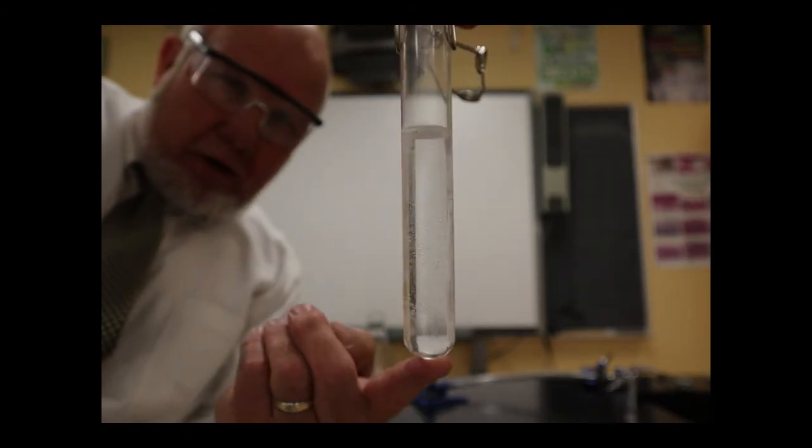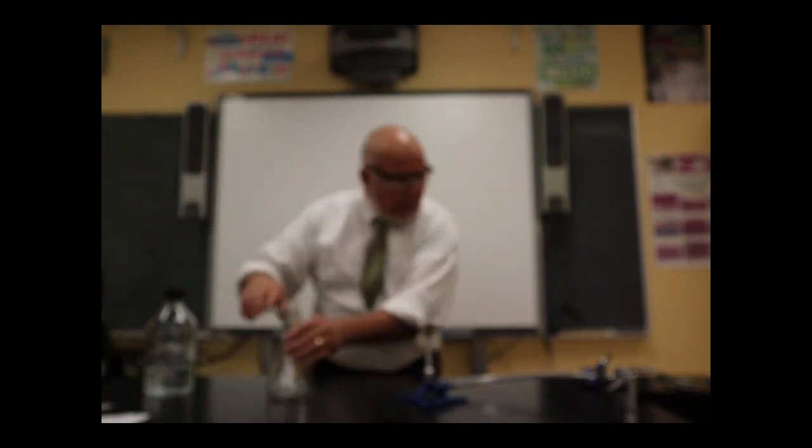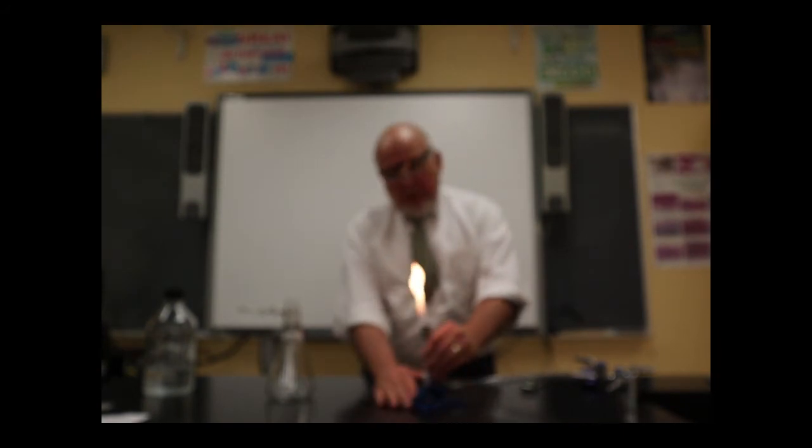And so that looks pretty good. Looks clear. You can't tell that there's something in the water. So let's see if we can bring it over here. Set this up. Light my burner. Oh, well, I've got to turn on the gas. That would help. So, take my flame. I'm going to turn the barrel so that air can come in through the bottom of the barrel. The oxygen makes a hotter, richer burning flame.